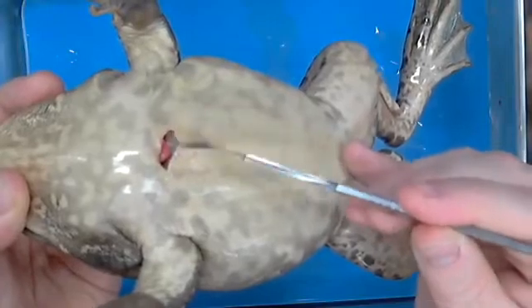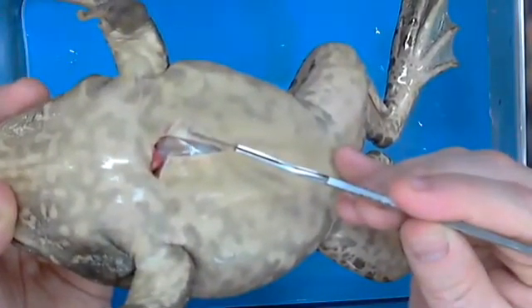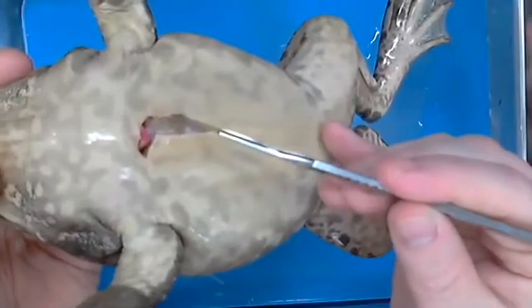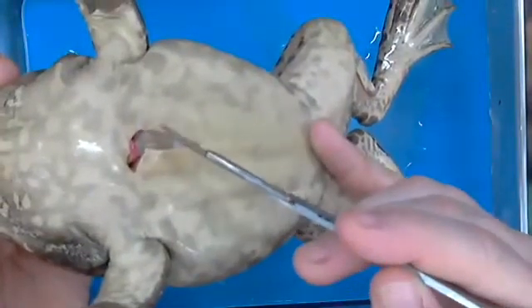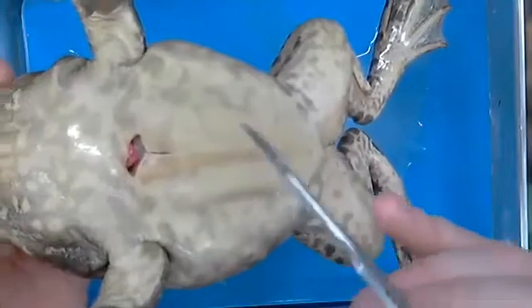Because of water absorption. Part of it's water. What else? Because when they breathe or whatever. Right. So Emery's right. They breathe through their skin. Part of their oxygen retrieval is through breathing through the actual skin itself. Okay, and so they take in oxygen. So their skin is very, very thin. You're also going to notice something about that.